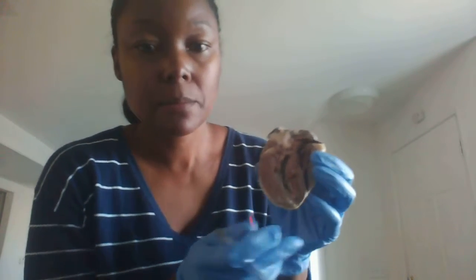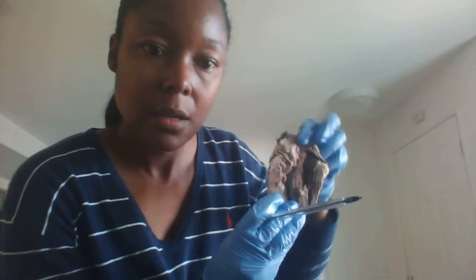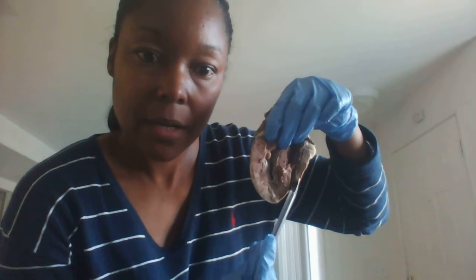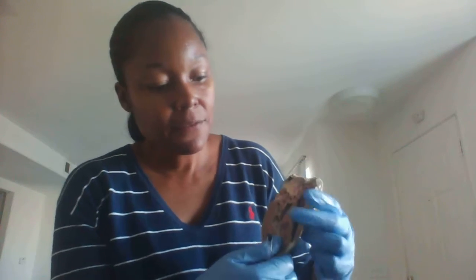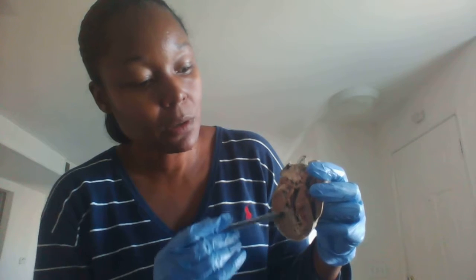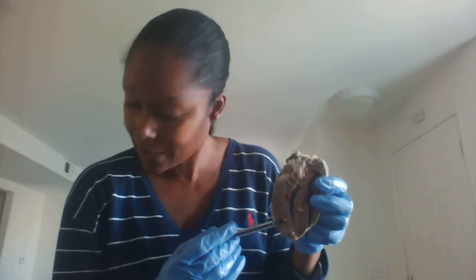Okay, we're going to look at the myocardium of the right and left ventricle. And this is the myocardium of the left ventricle. And then the myocardium of the right ventricle. Okay. All right, and the left ventricle is a lot thicker than the right because it has a little bit more work to do in carrying out the blood to the rest of the body tissues and the systemic circuit.